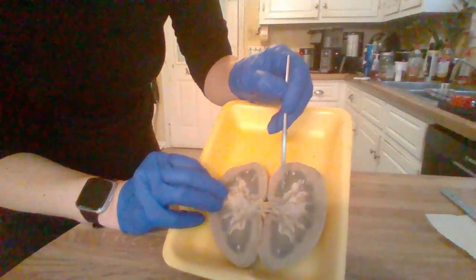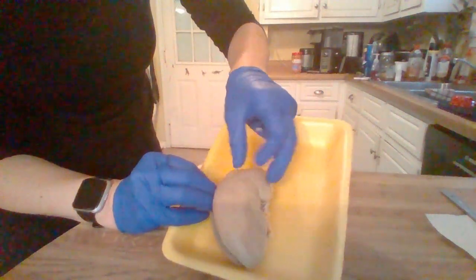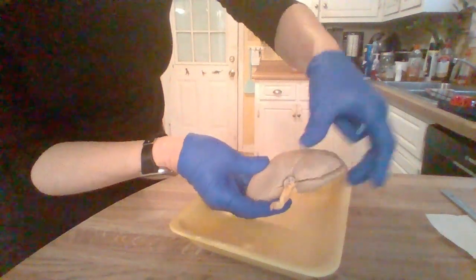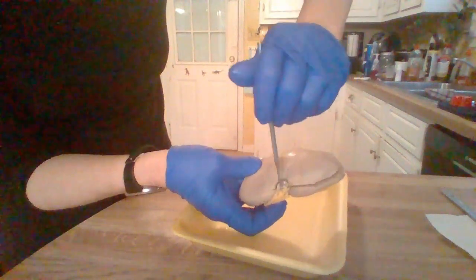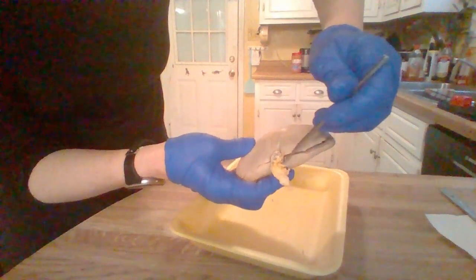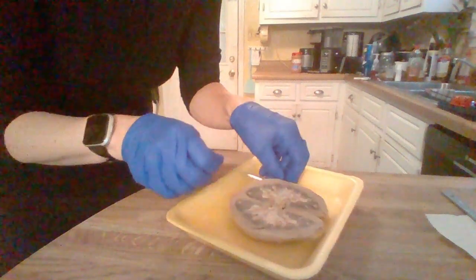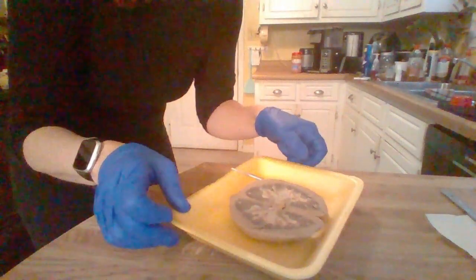And then, let's see, I had the renal hilum, I think I already said. And then, I'll close this back up. And you have where it kind of, this is the fibrous capsule here on the outside, but you can see some that looks like where the arteries and vein, renal artery and vein would go into. But then this right here, we would have the portion that would extend out, the superior portion of the ureter. And I believe those are the main portions of the sheep kidney.